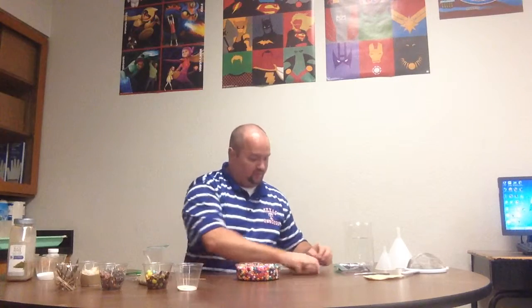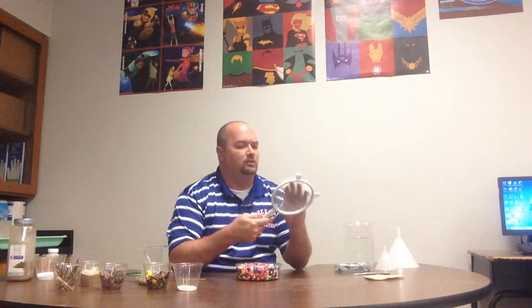Let's talk about the colored beads. We're not actually going to do the colored beads because there's 1,500 of them and I'm not separating out 1,500 beads. But I've got some tools over here. If I can get my bead to stand there. I've got this strainer filter. But that doesn't really help me. That doesn't really do anything.